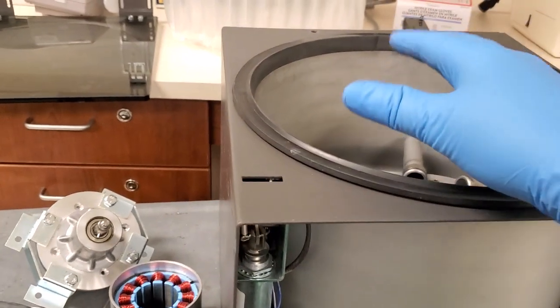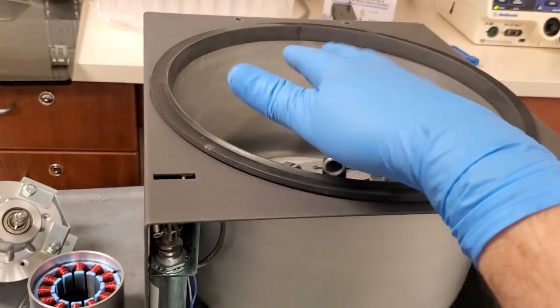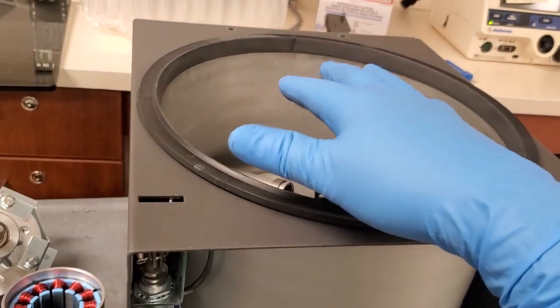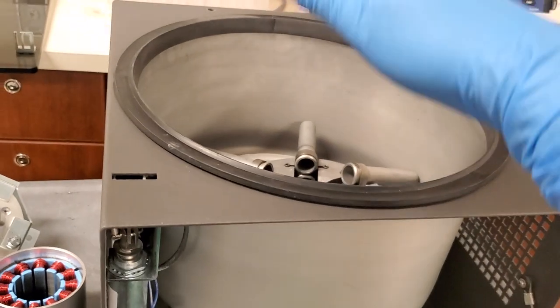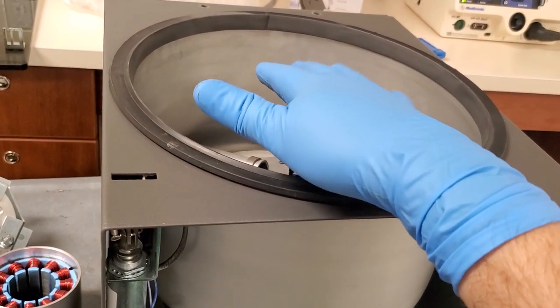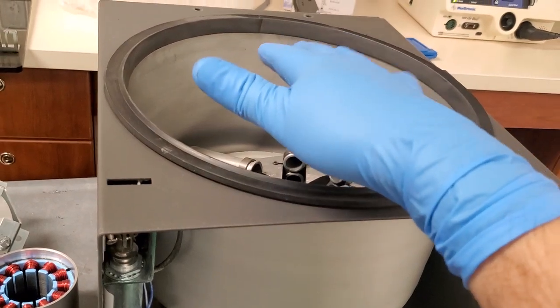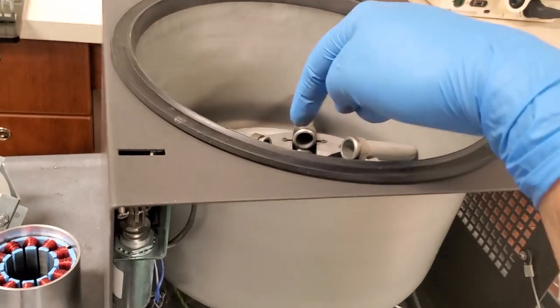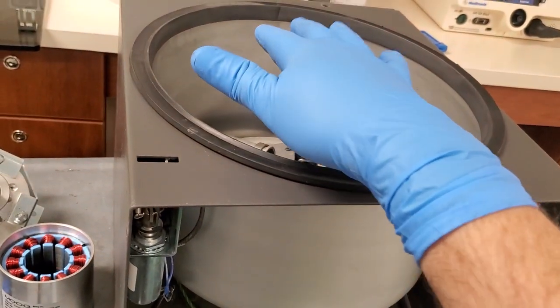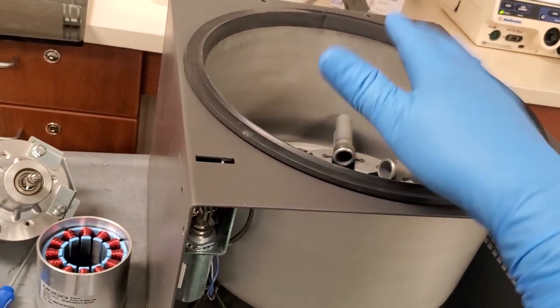Because if it continues to vibrate, you know, things that spin will develop harmonics, and at certain RPMs, certain structures will have their own frequency. So you'll feel it up into a certain harmonic, and then it will smoothen out, and then as it speeds up even more, it'll vibrate some more, and then it'll reach its second harmonic. So you have to be wary of that. So feel for the vibration. Just because it smooths out does not mean it's okay. It just means that it made it through that harmonic.